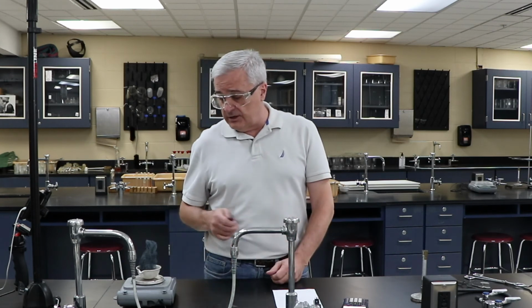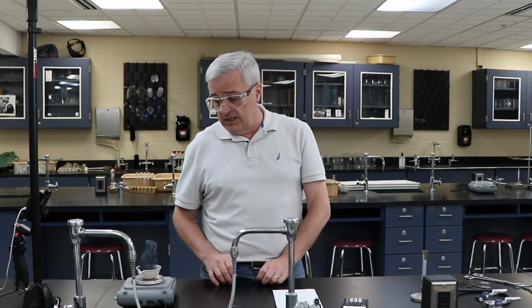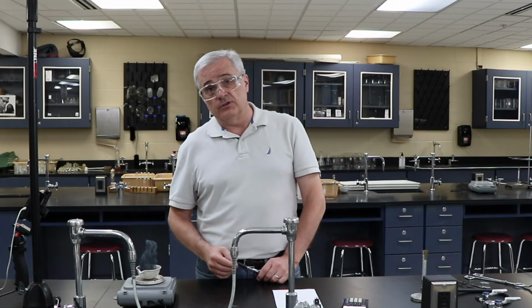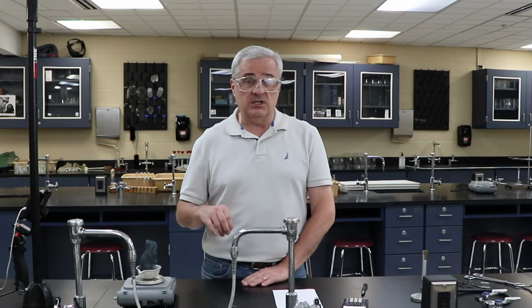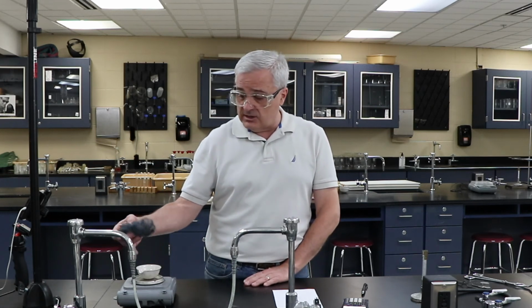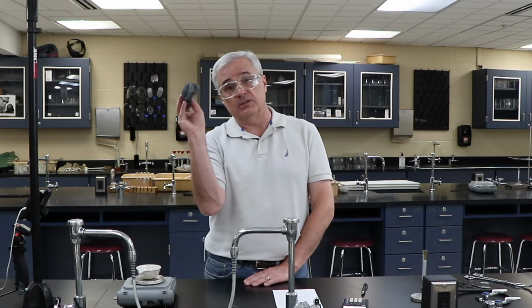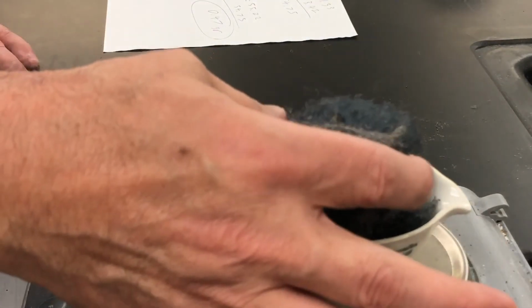We're also dealing with a class laboratory scale, also a limitation, and those are just some of the errors that are present. If you are looking for lots of ways of discussing error, you can see that some of the iron did not even react. So there's yet another source of error.